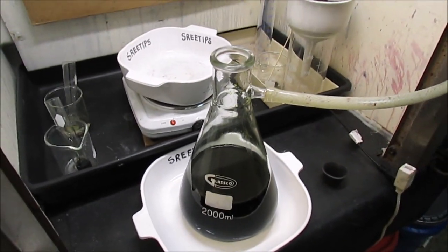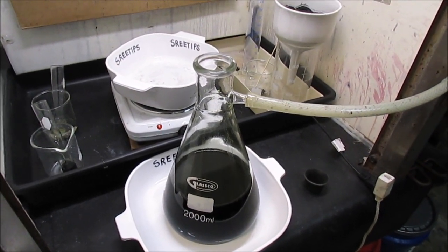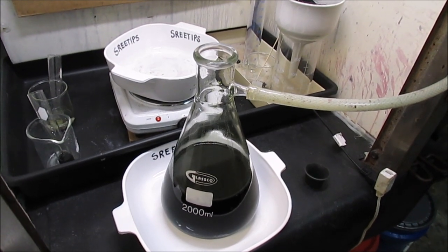I'm going to abandon the sulfuric acid idea — I don't think that's a good way to go. I'll set that aside for now. We'll get this solution in a beaker and get the metals precipitated out with zinc.